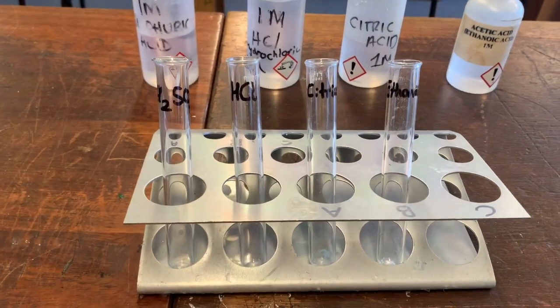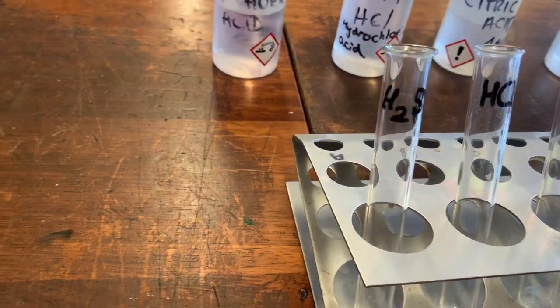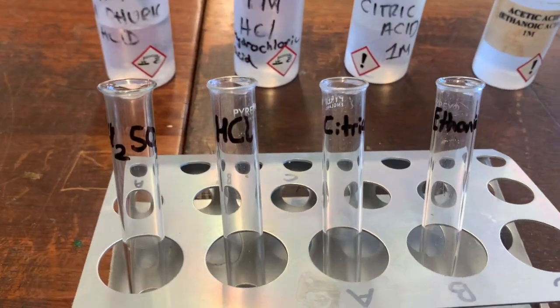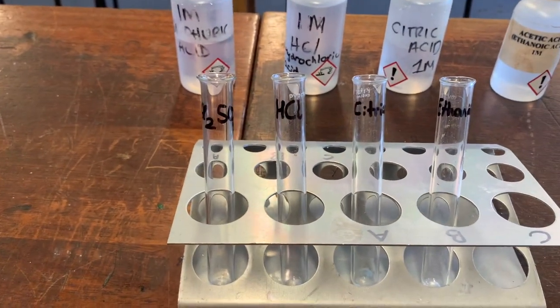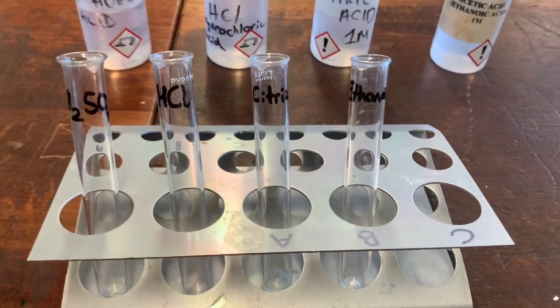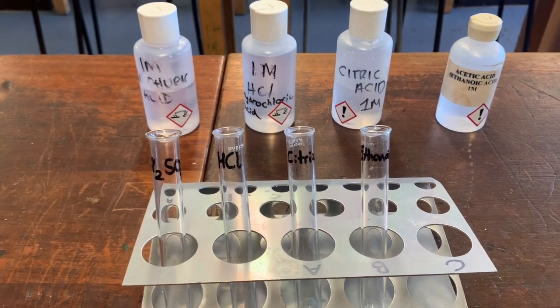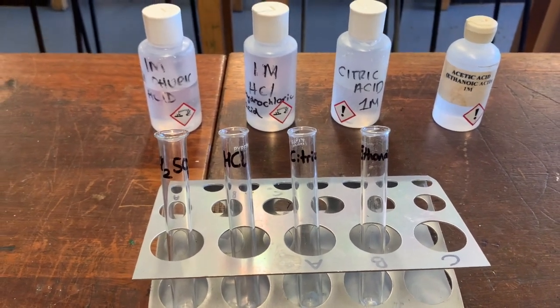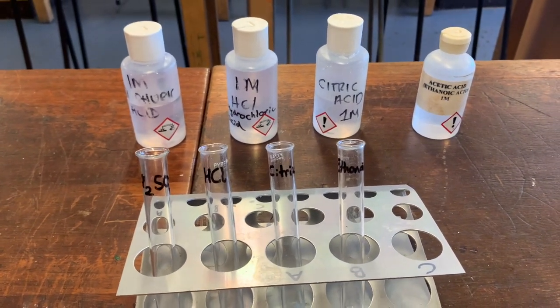I've set up four test tubes for my experiments. You can see I've written the chemical formula for sulfuric acid, H₂SO₄, and the chemical formula for hydrochloric acid, HCl — because I can't be bothered to write their full names. Citric acid and ethanoic acid have very complicated formulas so I haven't written those here. In the first experiment I'm going to test each of these with pH paper to see what the pH is, and I'll check that against the pH scale. You need to look at the color and decide what pH each of these acids will be.